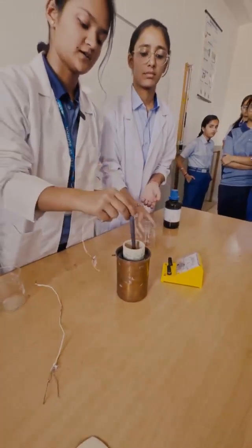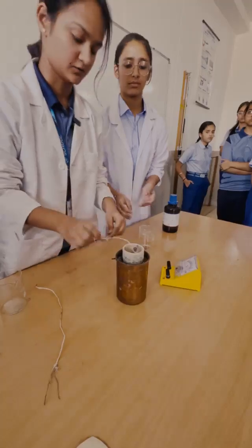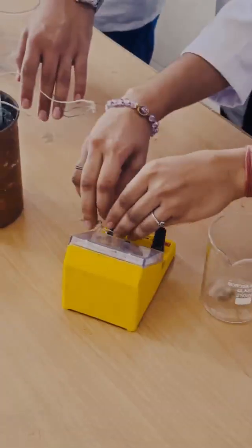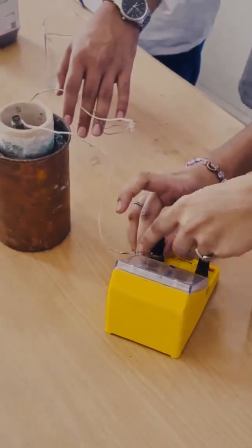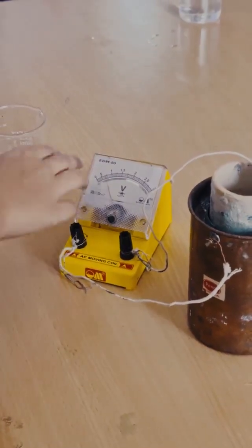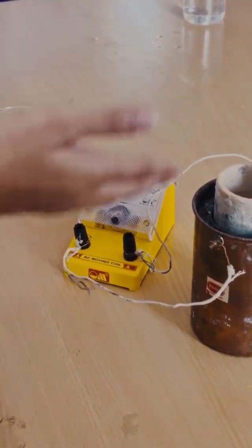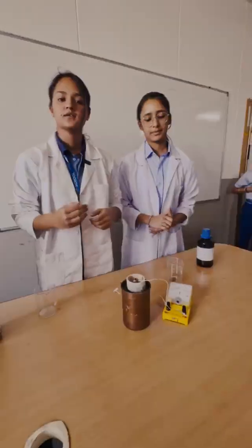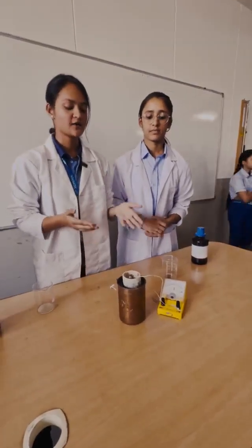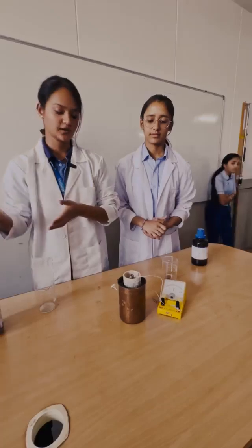Then we are going to add a zinc rod into the H2SO4 and we are going to connect the wires. Now that we have connected the wires, we see a little bit of deflection showing that there is current passing through the circuit. This is an example of an exothermic reaction and here we see the chemical energy transferring into electrical energy.